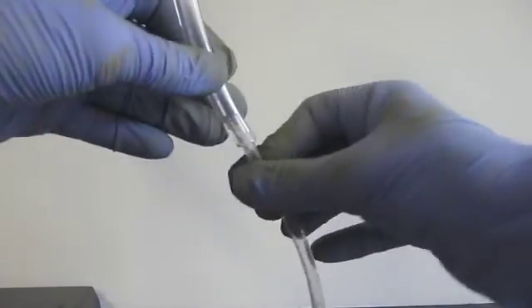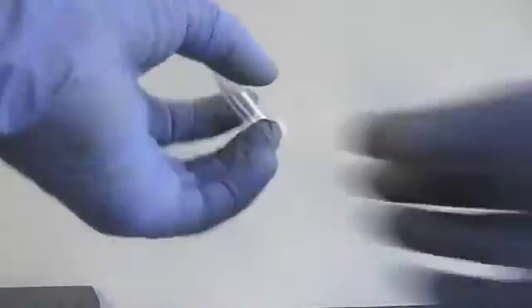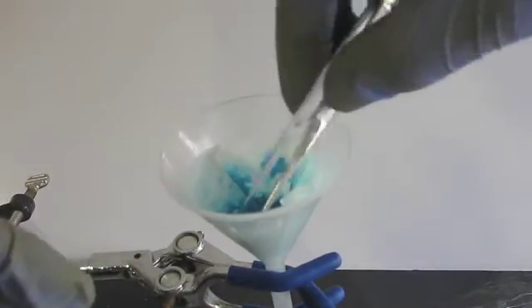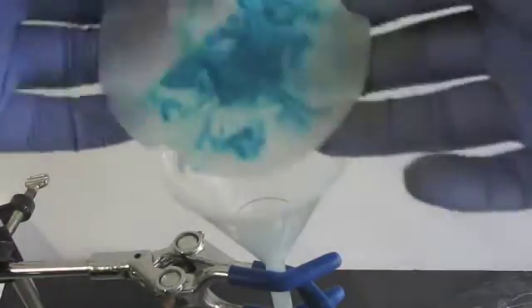Now remove the small length of tubing from the larger one and stuff in a piece of cotton from the cotton ball. Wet it and then reconnect the smaller tubing. Pull out the filter paper and wash the funnel to remove any adhering solution. Pull this liquid into the syringe, empty the syringe, and then reattach it.